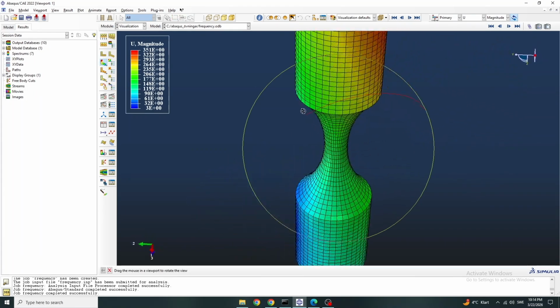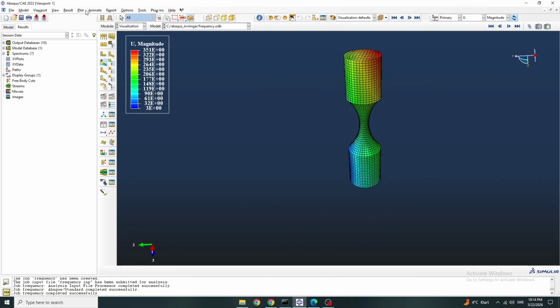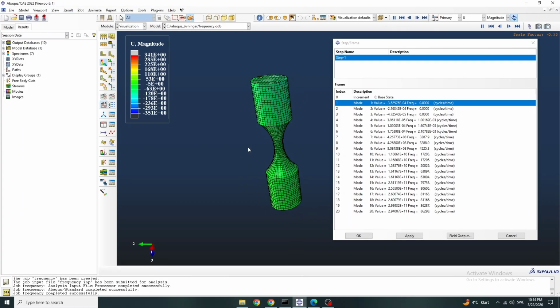When it is done, you go to results, we go to results, step, frame, and you can see the different mode shapes. You can animate it.